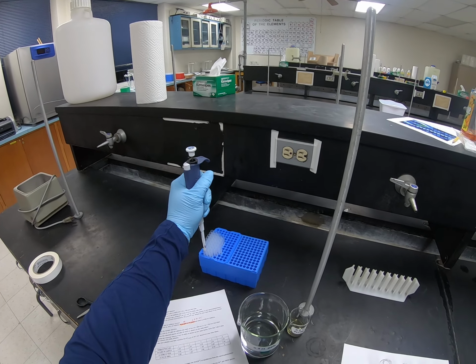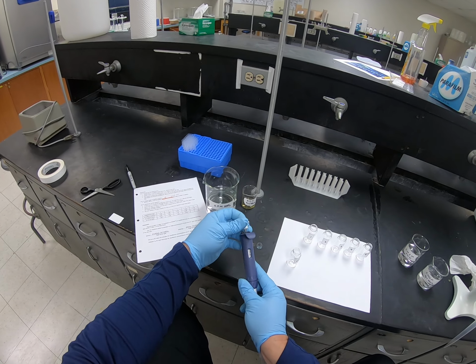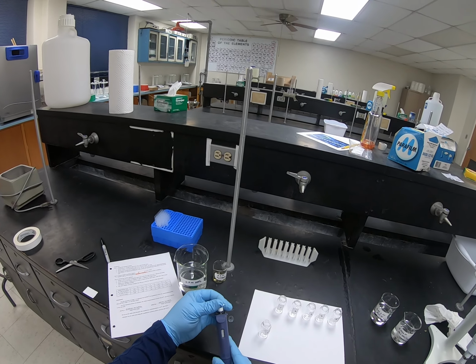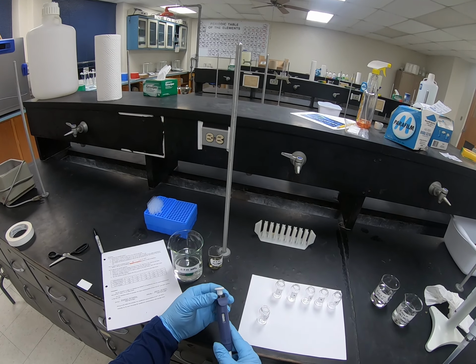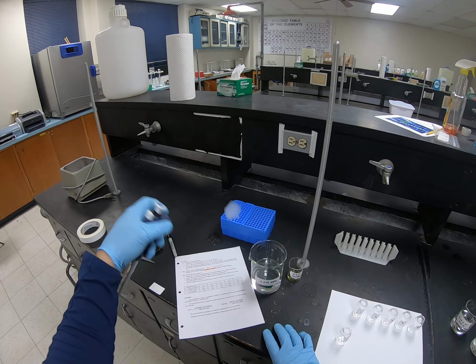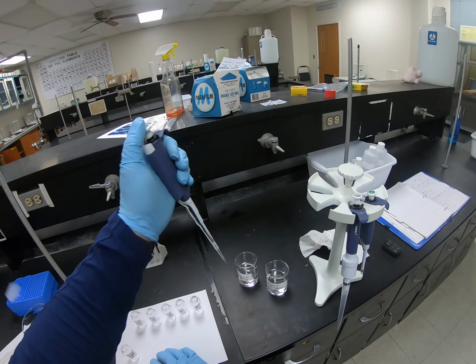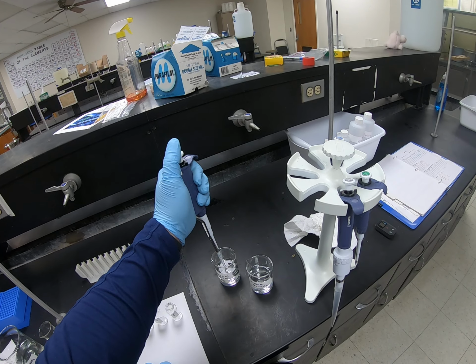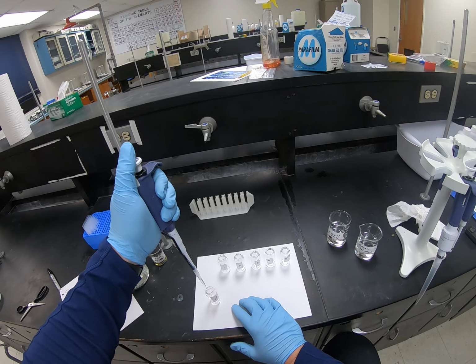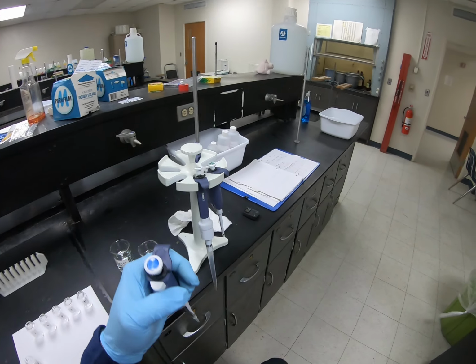So I've got my micro pipetter, and I need to set the volume so that it reads 1/2 ml. So let's go to 0.50. And then if I go to my solution, make sure I'm getting the right things, it needs to be the 0.002 molar hydrogen thiocyanate. So that's this solution. I'm going to pull that up, dispense that in my standard, and make sure I blow it out. I'm going to move a trash can closer.